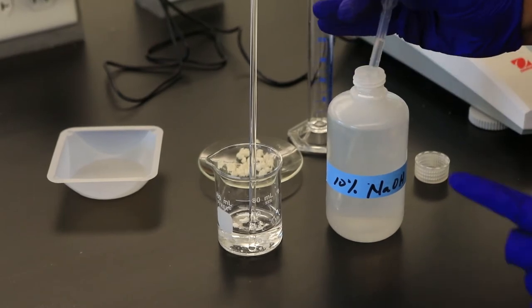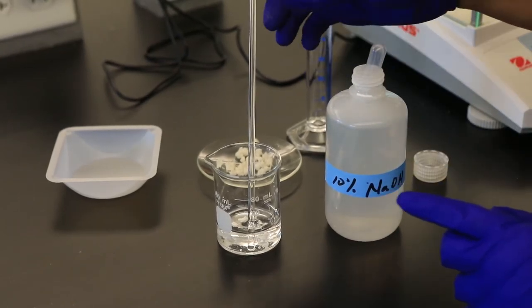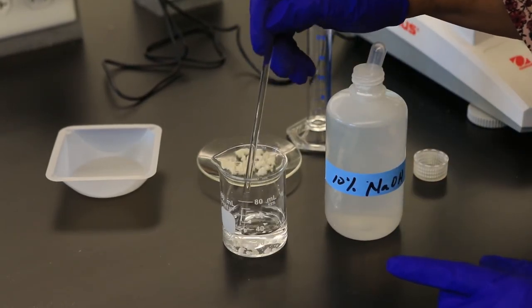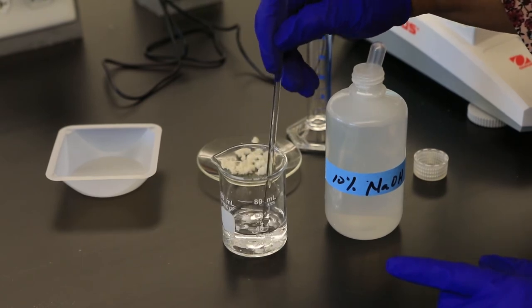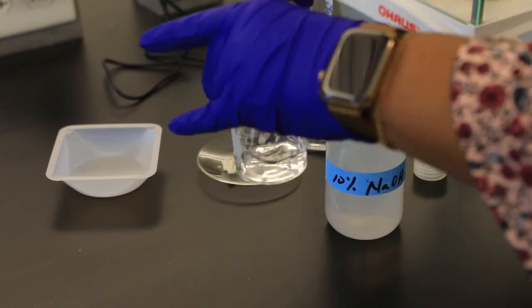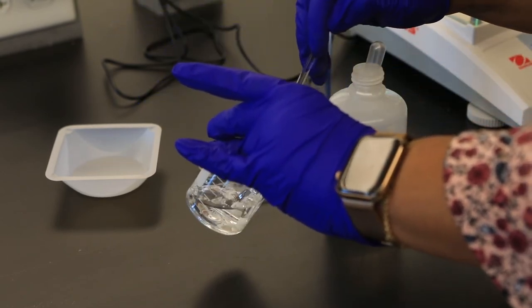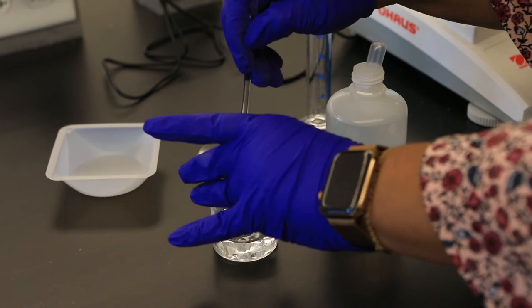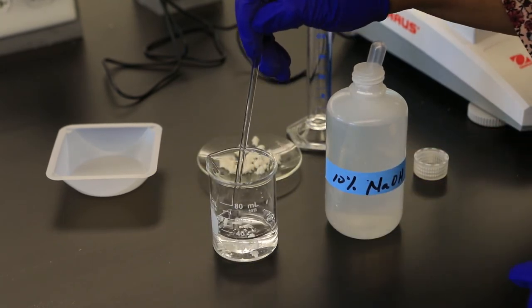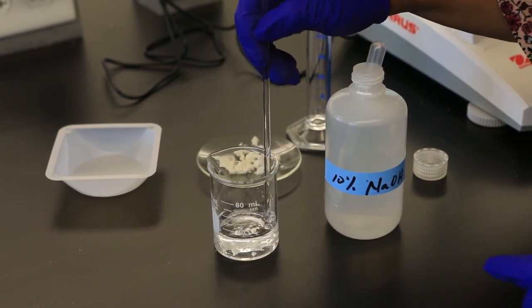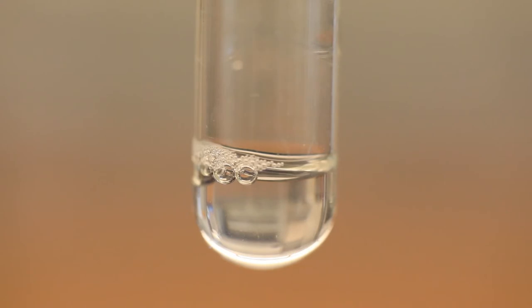Please note: if the casein does not dissolve after the addition of 5 drops of sodium hydroxide, I will need to continue adding sodium hydroxide to make sure I get all of the casein in solution. In this part of the experiment, we're going to do the biuret test, which is a test for protein.